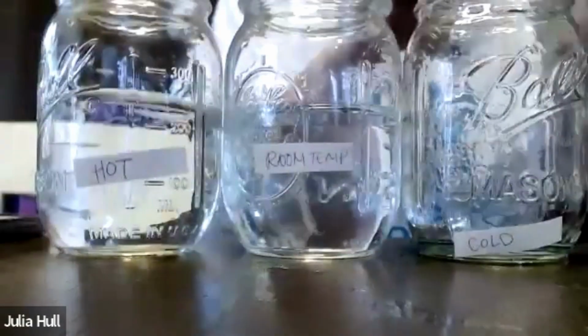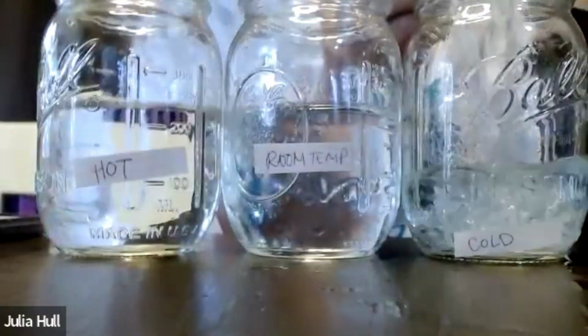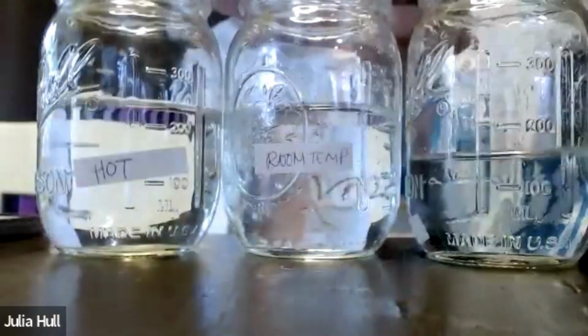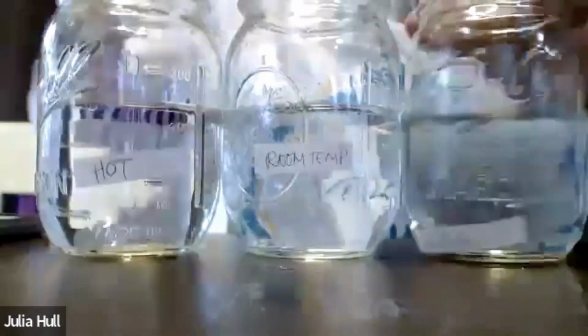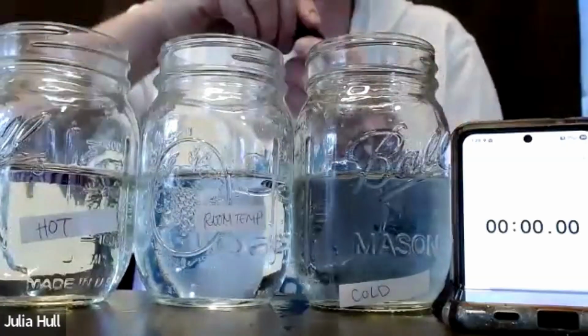Let's see. Start cold, room temperature, hot.